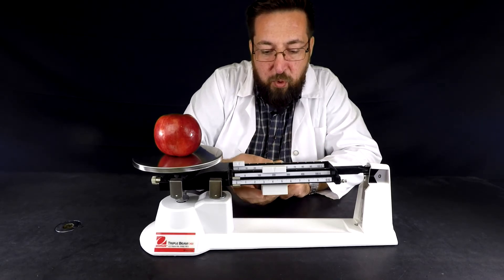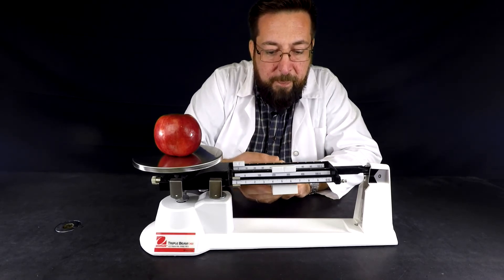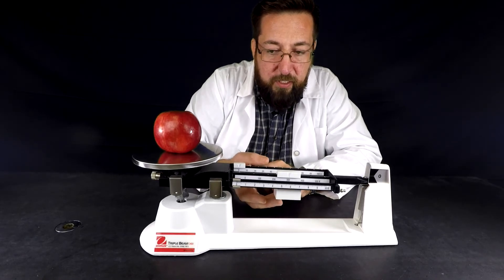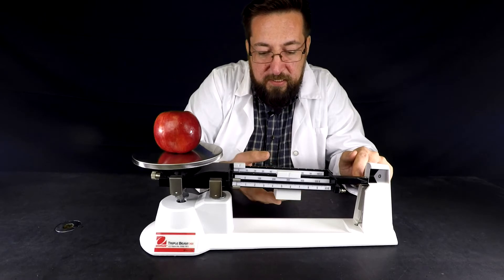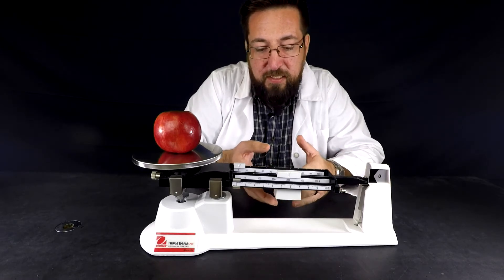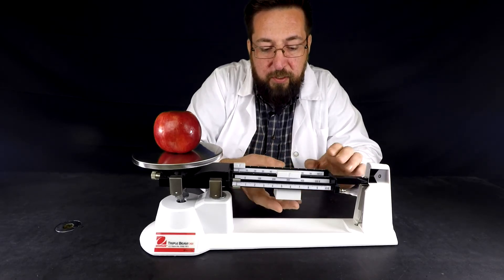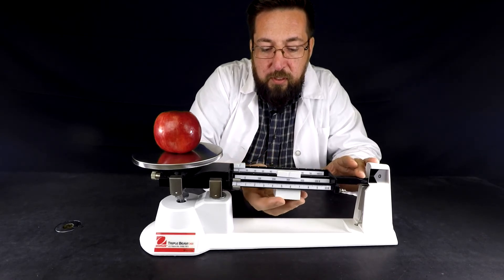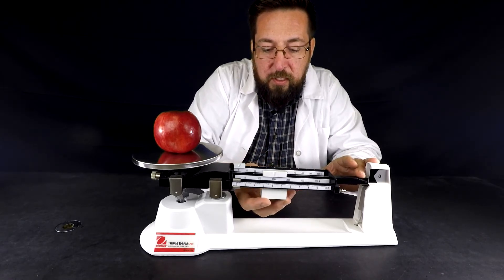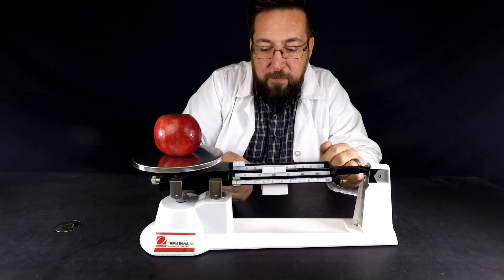Now 300 it went down so what that tells me is the correct mass is somewhere between 200 and 300, so I'm going to back it up to 200 and make sure it's in the notch and now I'm going to switch to my tens rider.